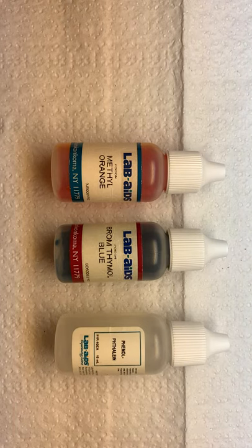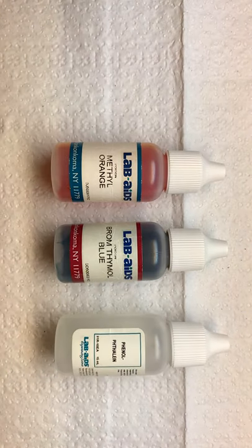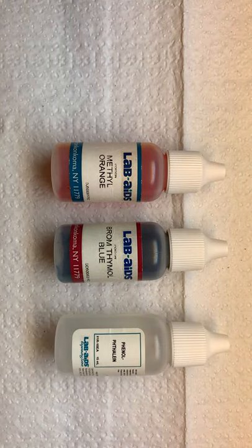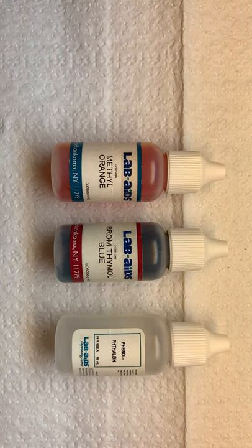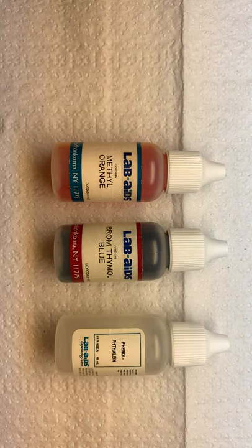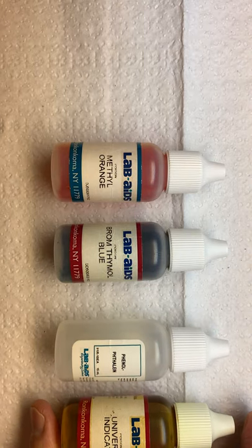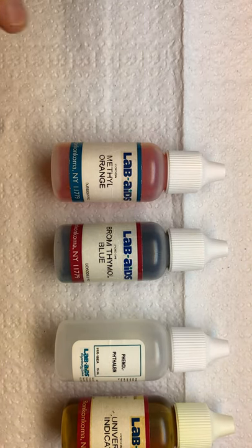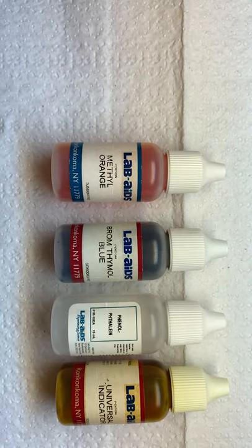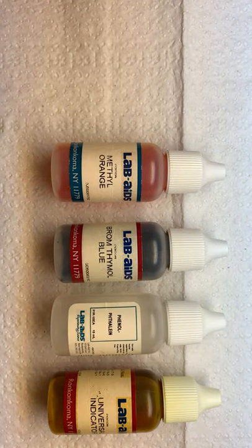I'm going to call phenolphthalein PTH for now, until we encounter a hormone also called PTH. But for this lab, you can call phenolphthalein PTH — just know that it is not only PTH. And then we've got a universal indicator.